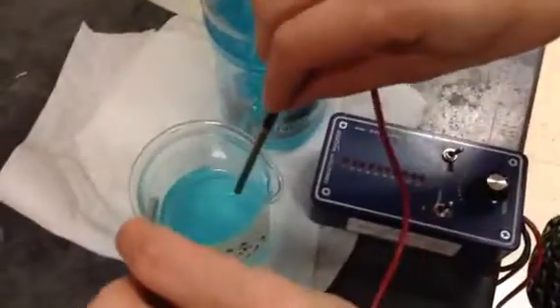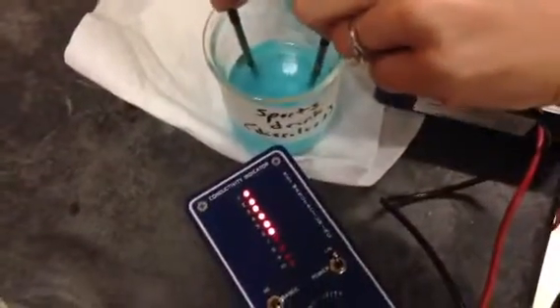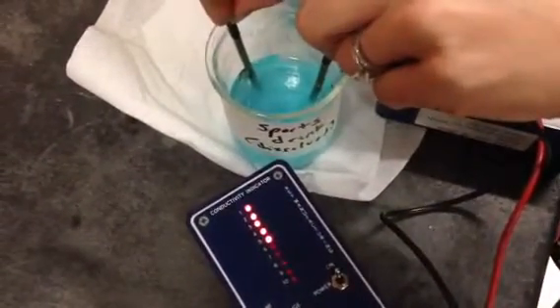Then we are, oh, I poured out the distilled water. We'll come back to that one. We've got sports drink. It's supposed to have electrolytes, so it should be conducting electricity because that's what that means. And hold on, this meter. That's getting a reading of 6. Very good.